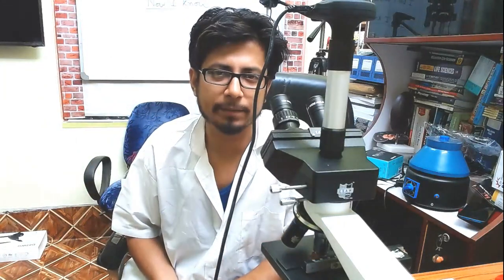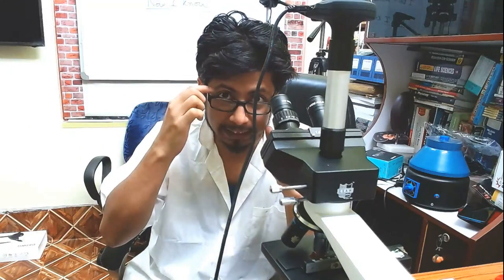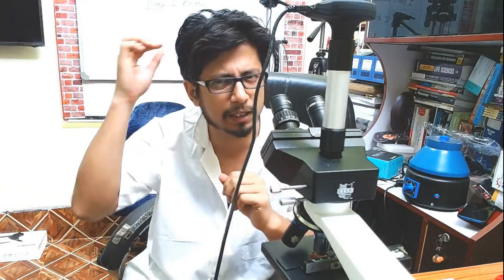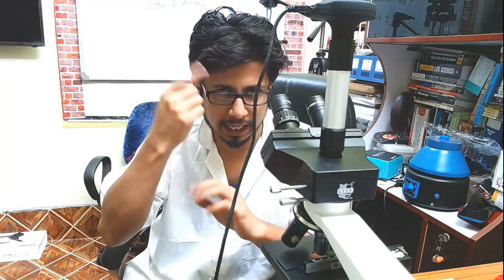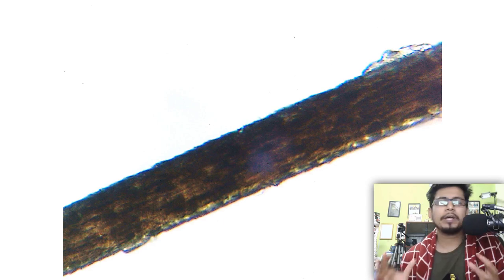Hello friends, welcome to another Adventures with Microbes and Microscope video. In this video we're going to talk about how our hair looks like under a microscope. You've probably seen a lot of commercials showing different pictures of the hair. We're going to see the eyelash first with the help of this microscopy video, which is very similar to that of the hair of our skull and head.